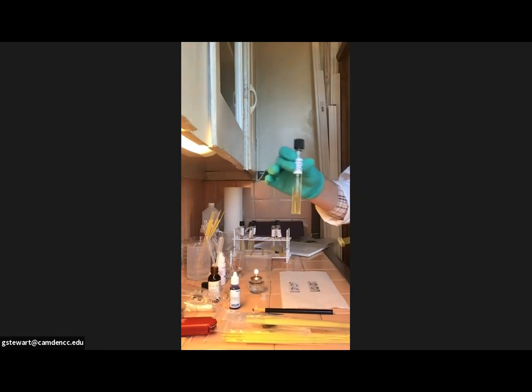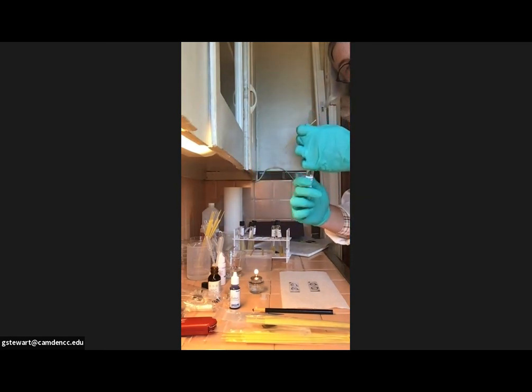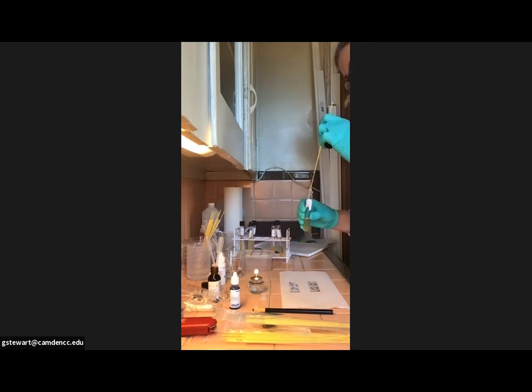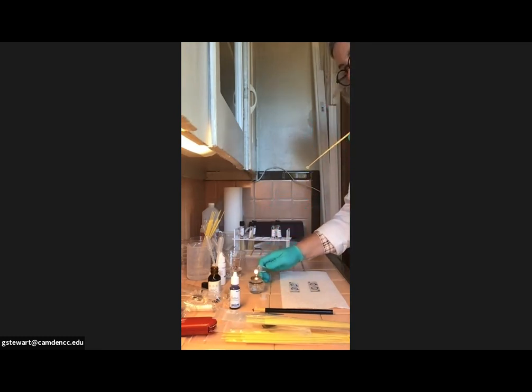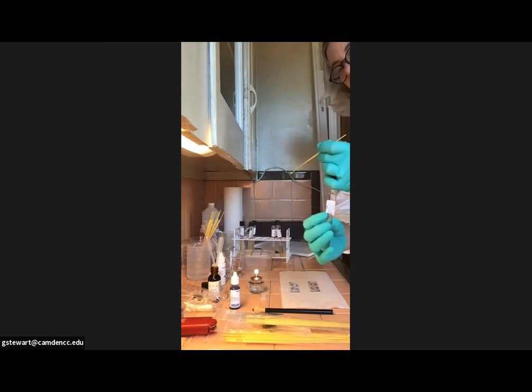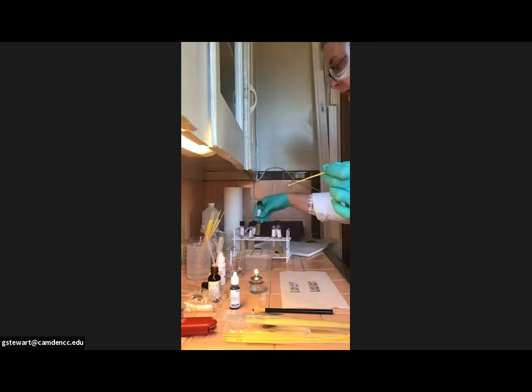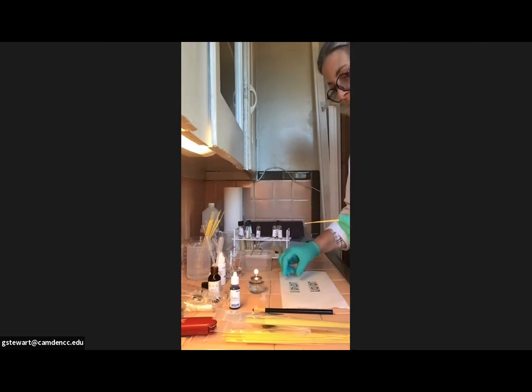So I'm going to take my E. coli tube, give it a little gentle swirl, remove the cap with my pinky by turning the tube, flaming the top of the tube very gently, taking my loop, popping it in here, again trying not to touch the side walls, removing a loopful, flaming, closing by turning the tube, not the cap. And then I'm going to put the E. coli back here close to my cultures I need to read tomorrow, so that, again, I'm working from the front of the rack to the back of the rack as much as possible.